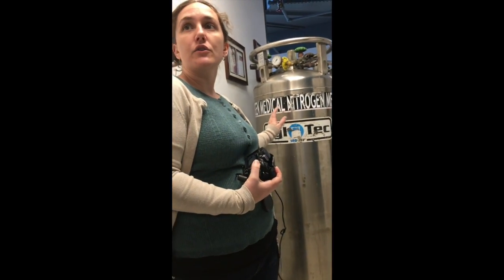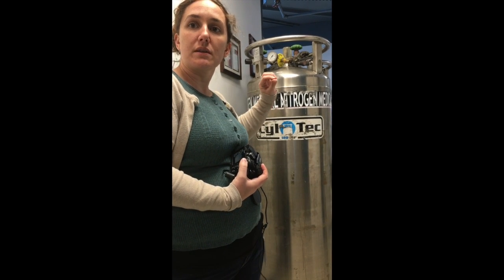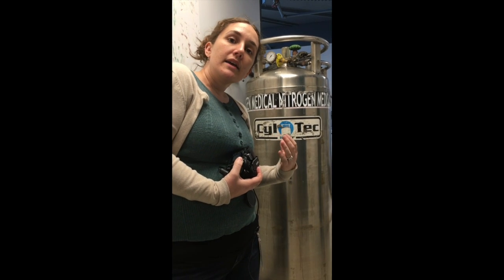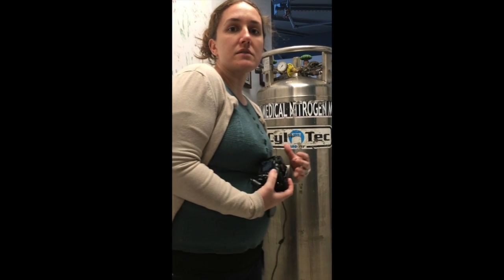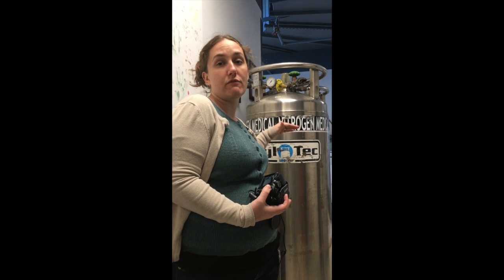For instance, if you were harvesting cells, you could freeze them very quickly in liquid nitrogen and put them in long-term storage. If you're harvesting things from animals, usually you would put it in a tube and then pop it into liquid nitrogen so that the proteins don't change, because once something is harvested very quickly, there's proteins called proteinases, and other enzymes that'll go through and just chew up everything. So if you really want to know what's going on, you kind of have to capture it at that one moment in time. And the liquid nitrogen is so cold that it helps us do that very, very quickly.